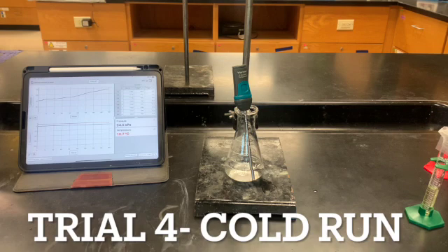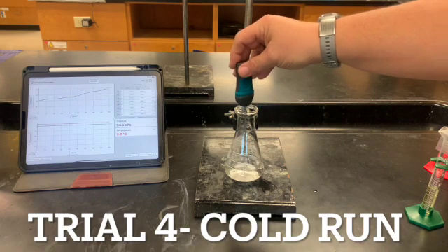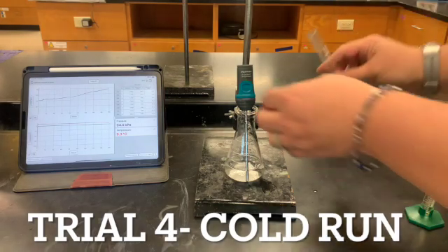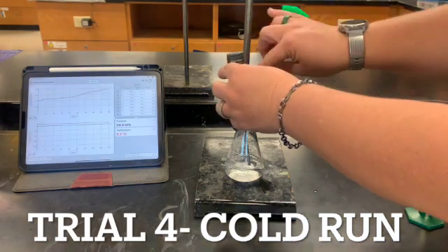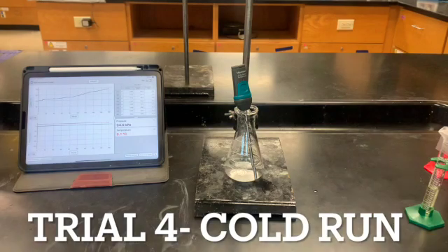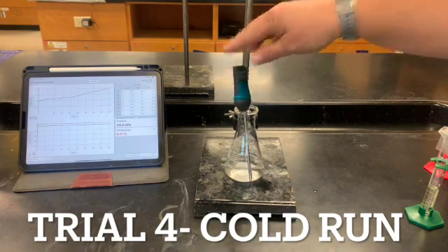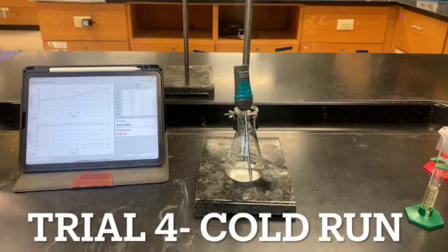And looks like we're almost there, right? Okay, looking pretty good. So almost 10 degrees below, all right? And here's my hydrogen peroxide that's also been in the fridge, getting nice and cold. All right, so I'm at 9 degrees, so about 10, that's okay. All right, here we go.